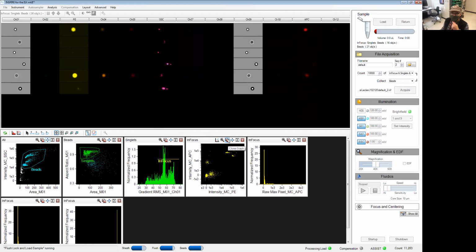The next thing we want to do is run the compensation controls. I just had the one sample today. Compensation needs to be done even though the two markers here are not overlapping. You still want to do that pretty much every time you run an experiment. Compensation is done on a pixel by pixel basis. It's not something you can actually do manually.